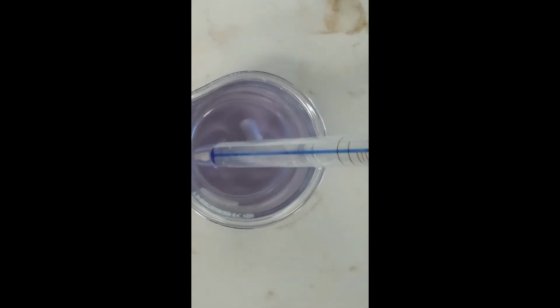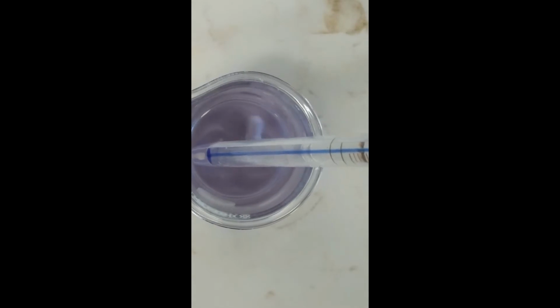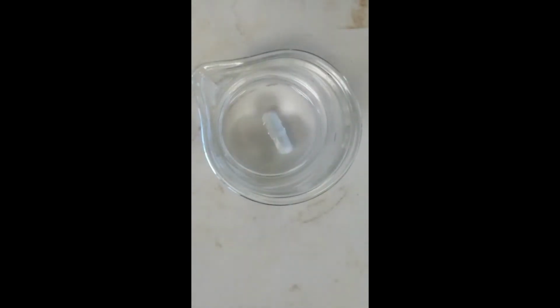Temperature of this solution is 24.2 degrees Celsius. Here is experiment 3. So 1 milliliter of starch, 2 milliliters of thiosulfate, 2 milliliters of water, 3 milliliters of iodide. And I'm about ready to add the persulfate. Are you ready to record? Here we go.